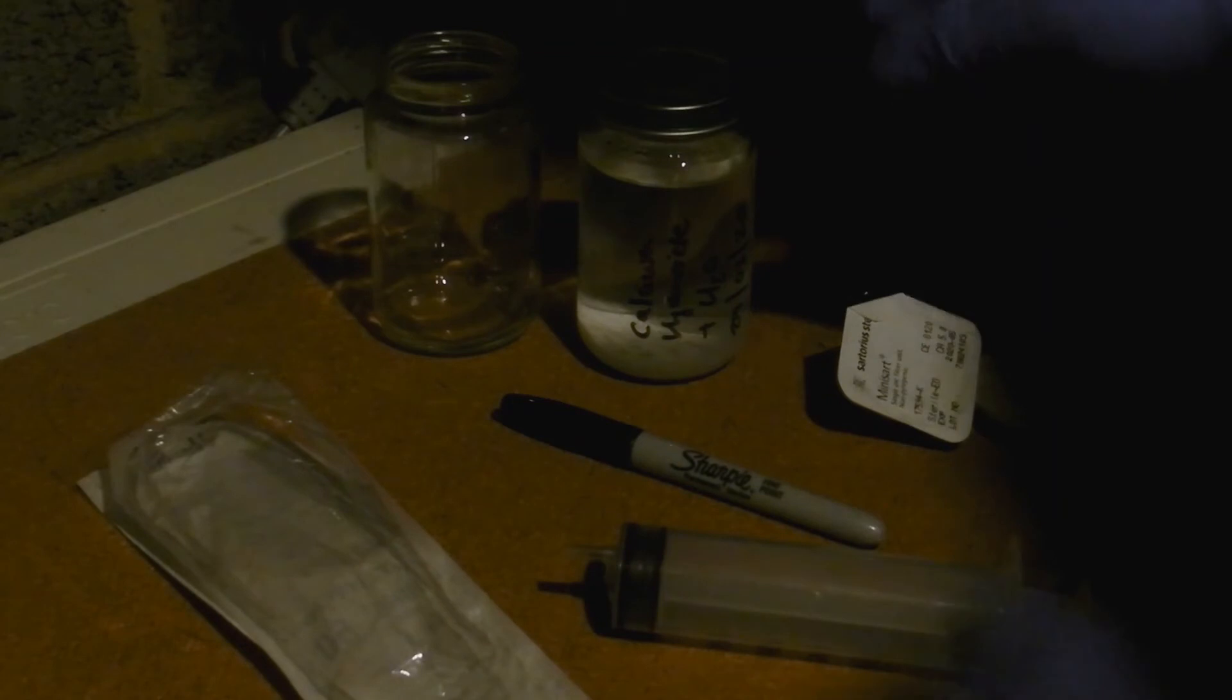Right, okay, so we've left our calcium hydroxide overnight and as you can probably make out, it's now sedimented at the bottom of the jar. What we need to do is we need to decant the supernatant. I'm going to do this with a syringe because I haven't actually got any filter paper lying about. We're going to draw it off with a syringe trying not to disturb the sediment at the bottom, and then we're going to filter it through a five micron filter that I have there. Now the idea here is to try and minimize the amount of disturbance within this bottle.